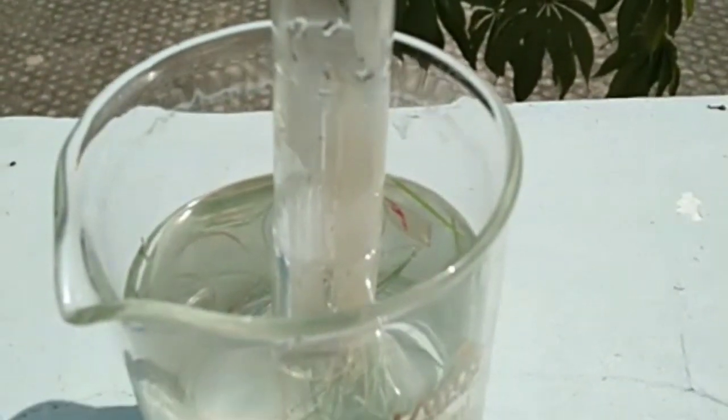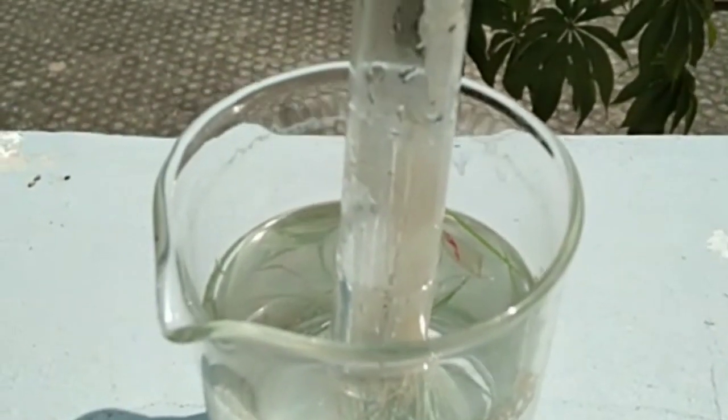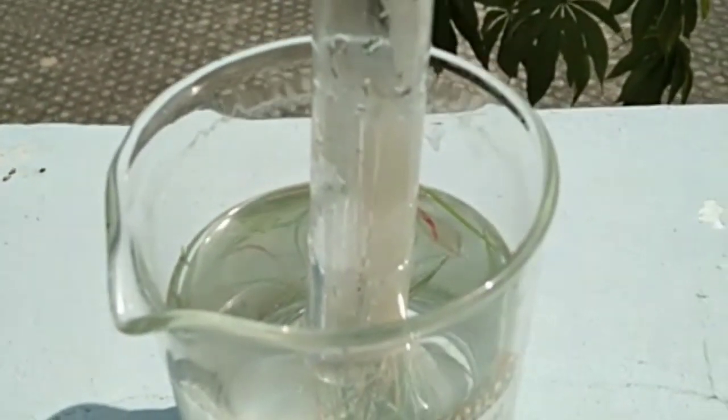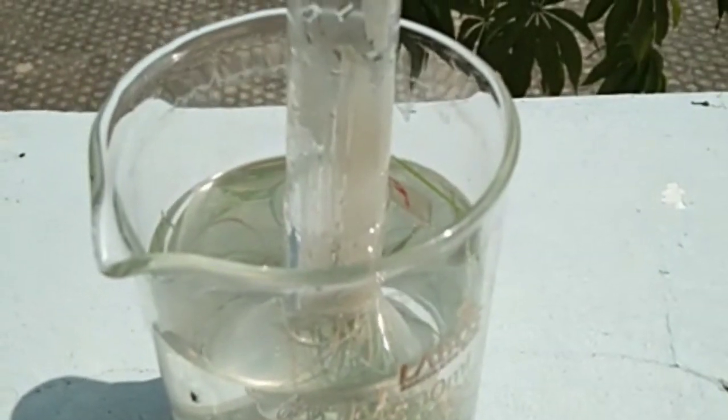So the bubbles come out. What is this? Oxygen is evolved. All plants take carbon dioxide and they evolve oxygen. This procedure is called the test tube funnel experiment. That name is called photosynthesis.